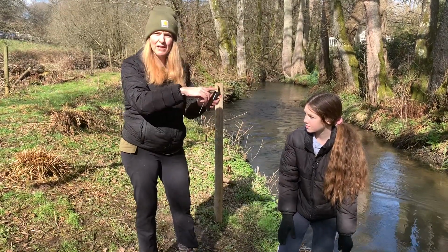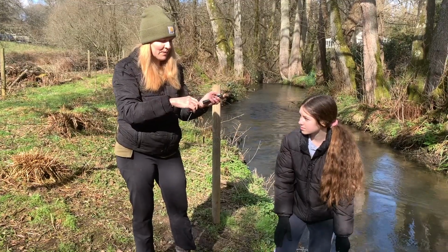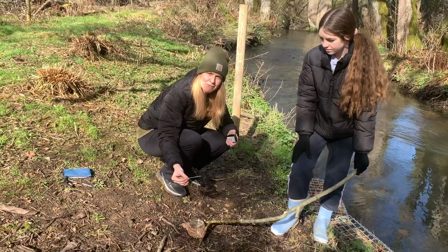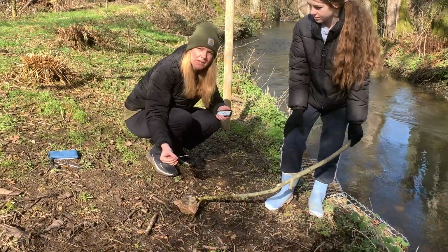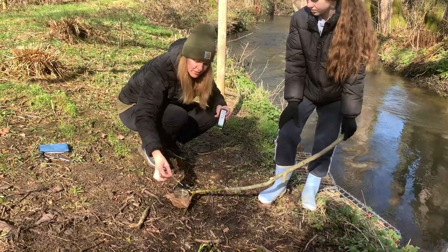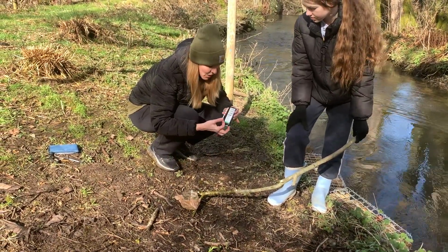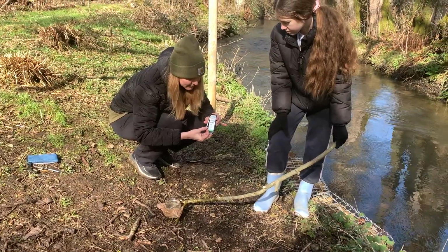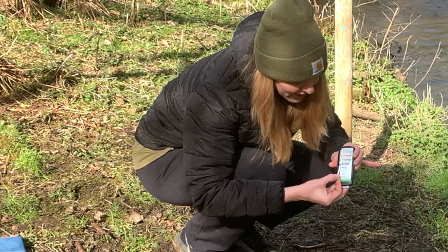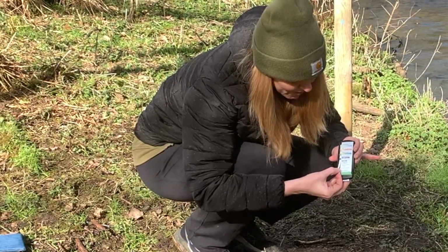And then we want to make sure we close the container right away, keeping it nice and dry. I'm going to dip it in for 2 seconds, and then I'm going to compare it to the back here. So, 1, 2. And then I'm gonna hold it vertically here and compare. So you can see the top value there is chlorine and it's 0.